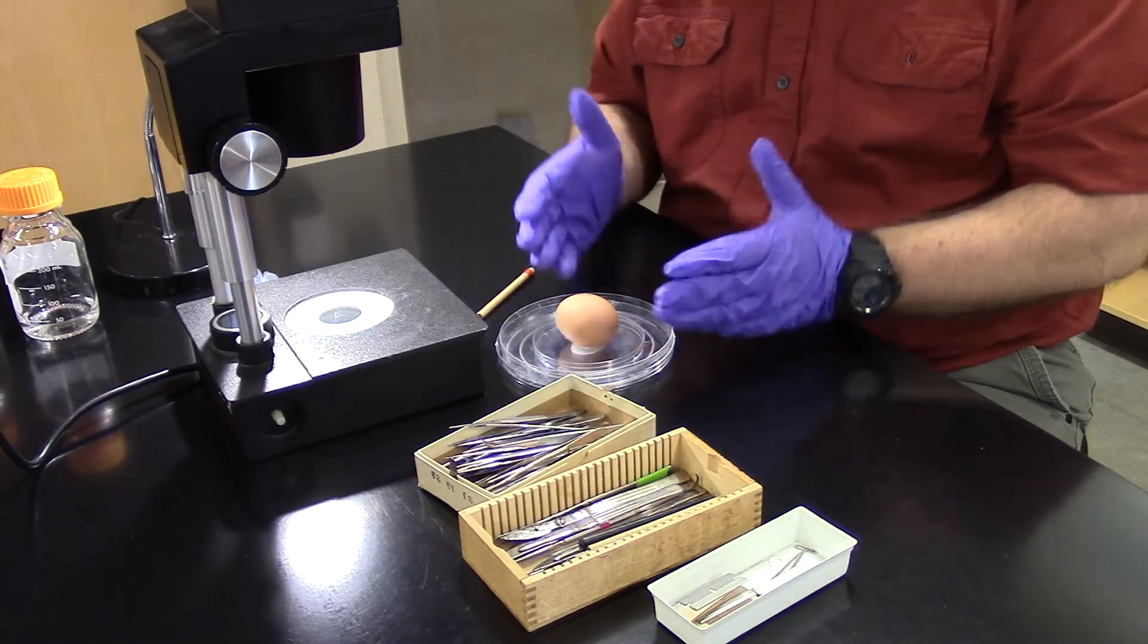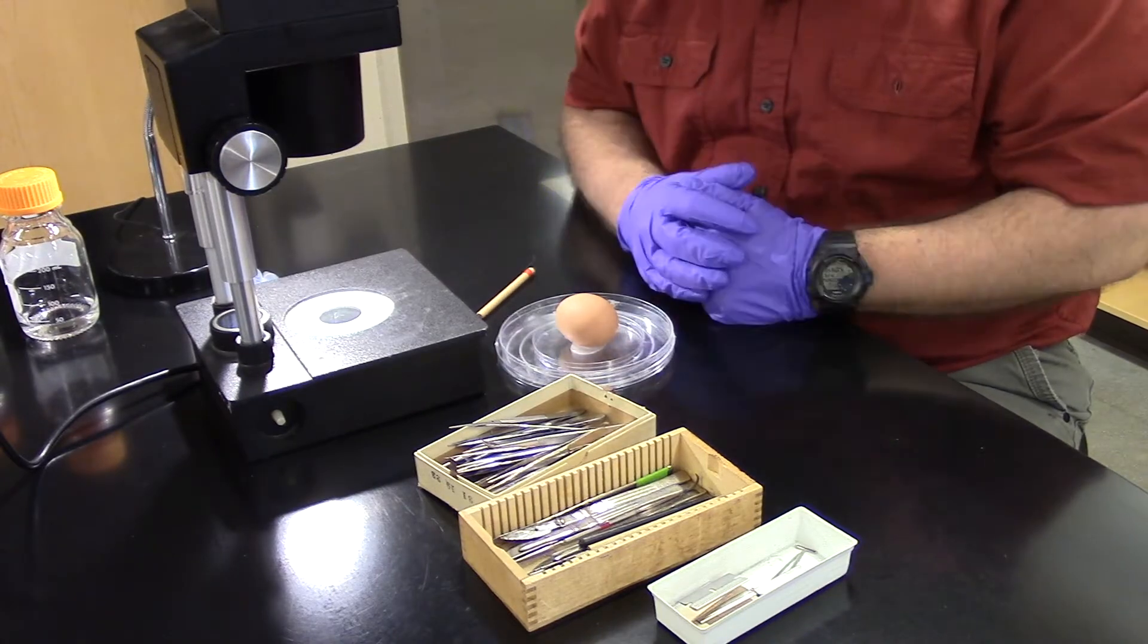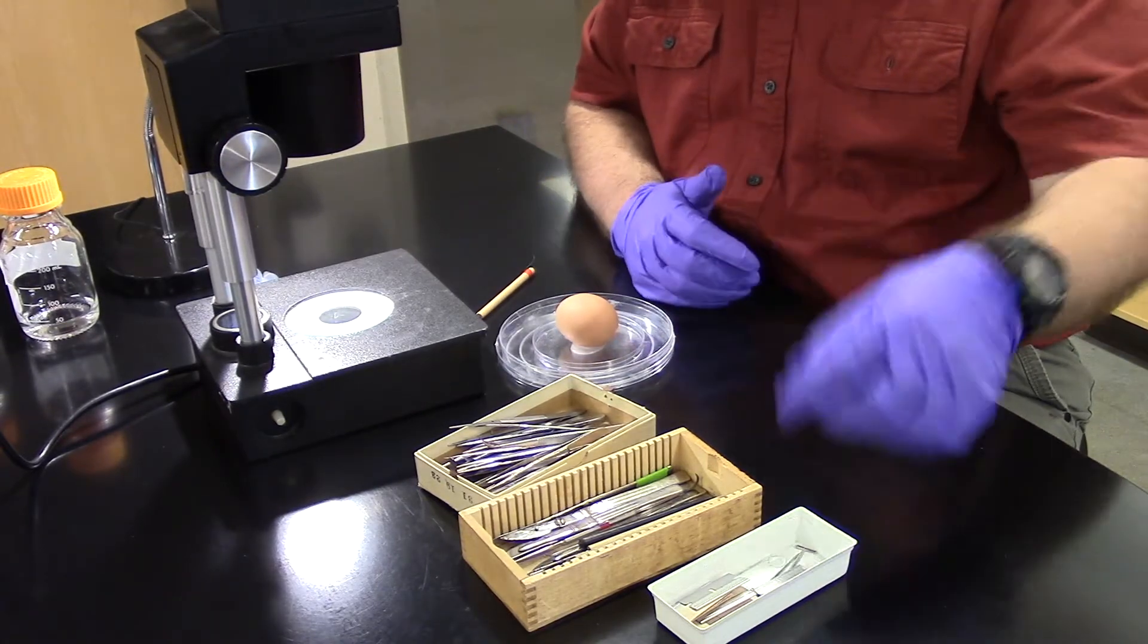However, today what we're going to do is just learn how to open it and see what it looks like to look into an opened-up living chick egg.